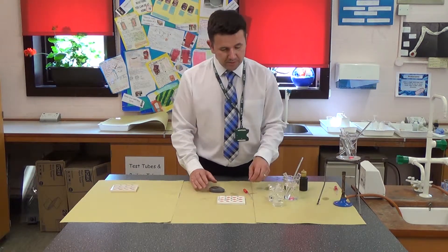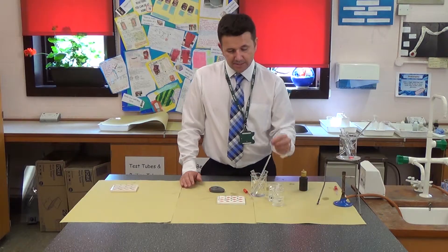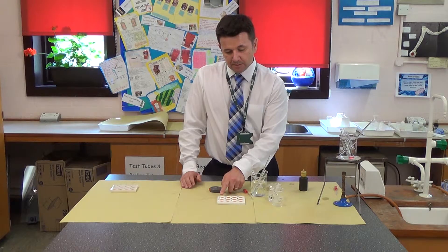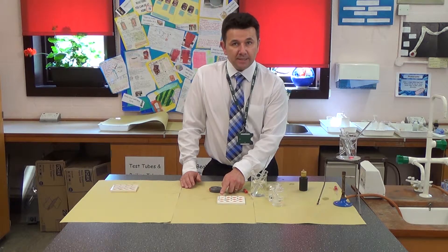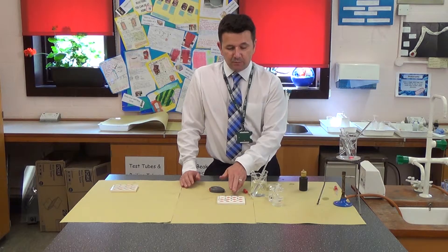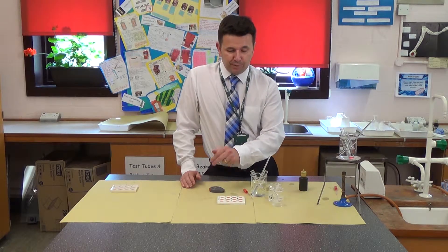I'm going to add my sample of amylase and starch every minute to the iodine. When starch is present, these brown spots will go black. However, once amylase starts to break down the starch into sugars, then it will start to remain brown.